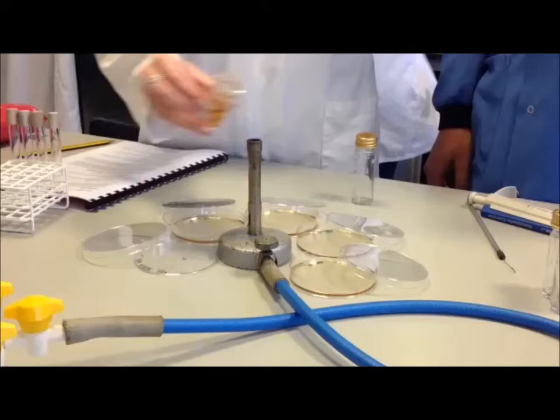And you can see the lids are balanced on the rim of the plate. Four of the plates have already been poured, and in the fifth one you can see a 100 microlitre aliquot of the water sample that's been pipetted into the plate.